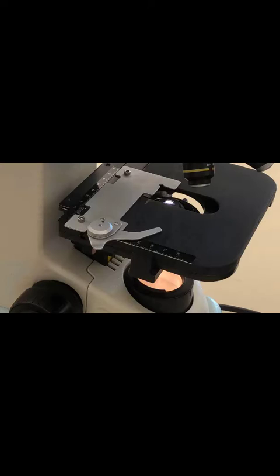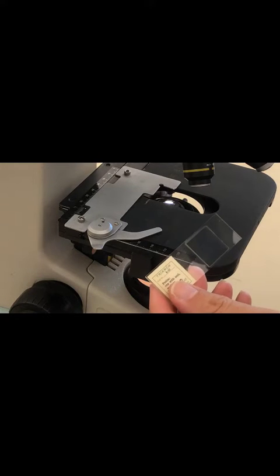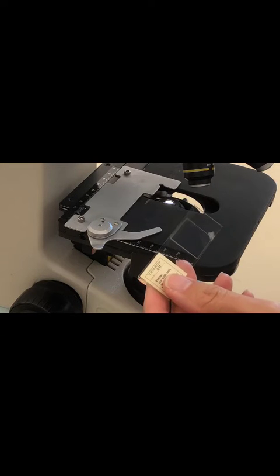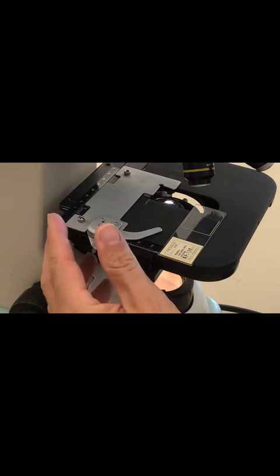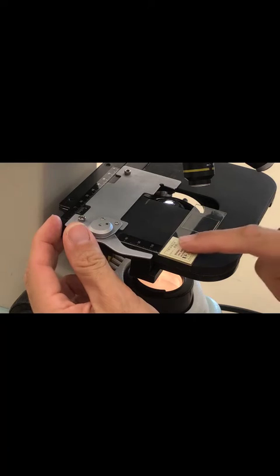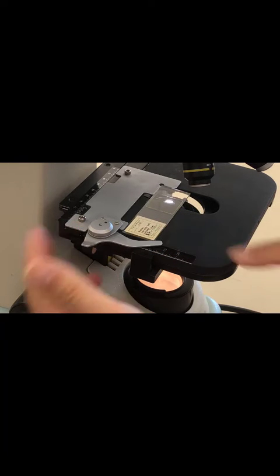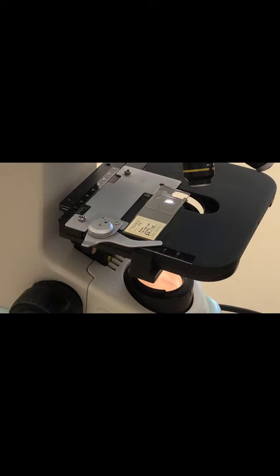You want everything to be pointing up. Place the slide on the stage, this platform here, with the cover slip and everything pointed up. Depress this clip and push the slide into place. Let go of the clip and you're good to go.